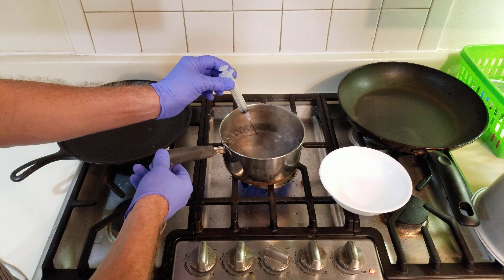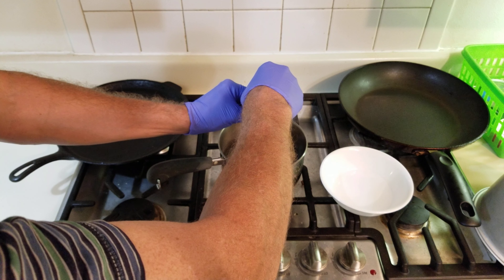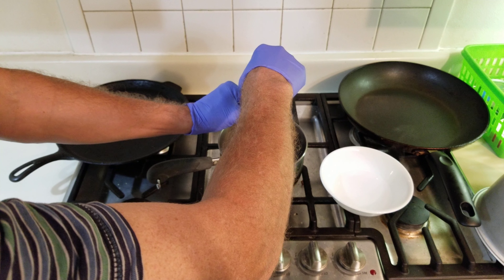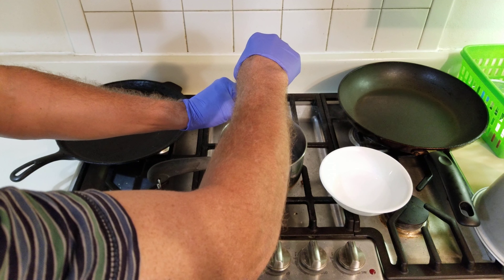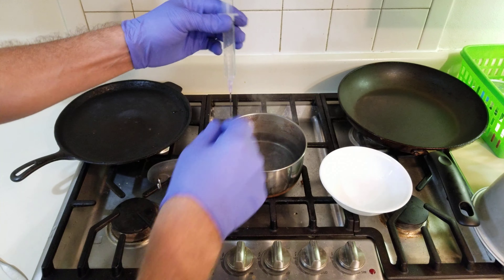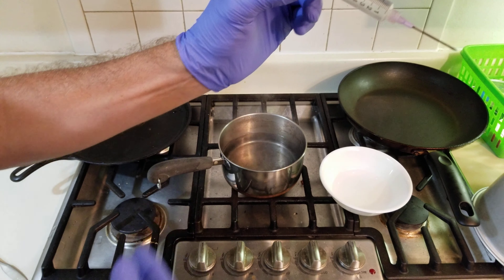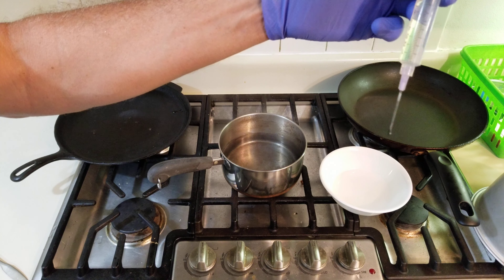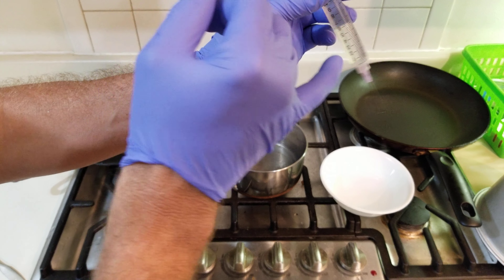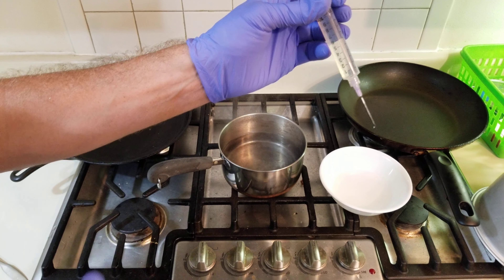I'm going to turn the water off just for a second to get the bubbles out, so we don't have any air bubbles when we draw the water in. And there we have 10 milliliters of boiling hot water inside of the syringe. This will have to cool for about an hour. At that point, we can draw up spores by injecting some of this water onto the spores, mixing the spores, and then withdrawing the water back into the syringe. Let's finish.